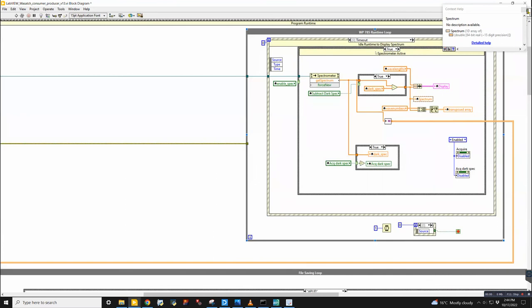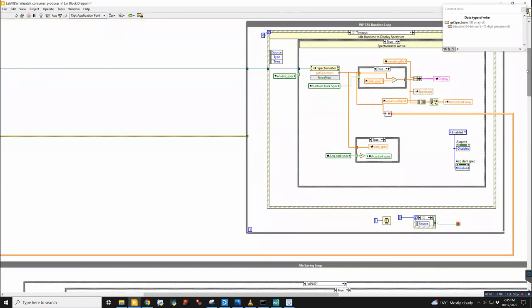So it looks like it's not really taking data every time from here. It's just spitting it into a local variable. So this works, but you don't really have explicit control over how the information is passed between loops. I think this is okay, but what you might run into is that one loop is running faster than another. And sometimes you may be taking the same spectrum that's in here and writing it twice to a file. Or it could be the other way around, where you're actually acquiring spectra faster than you can save them. So you may be missing spectra.